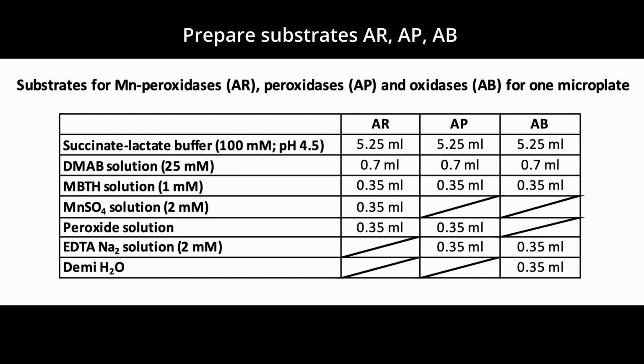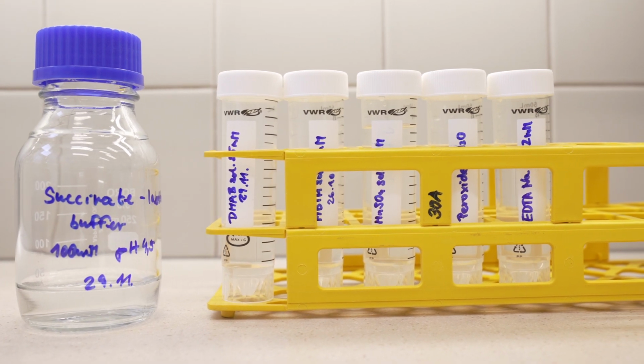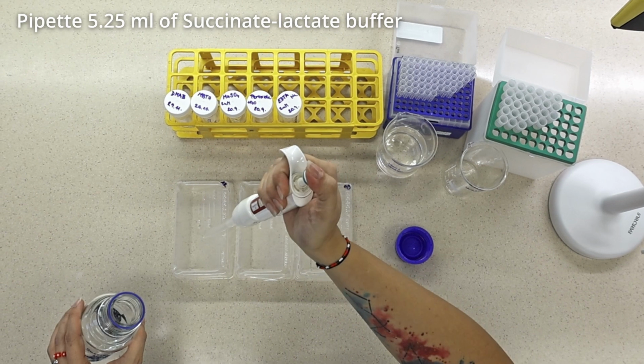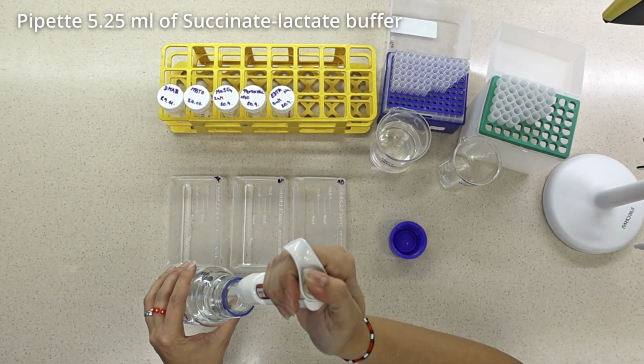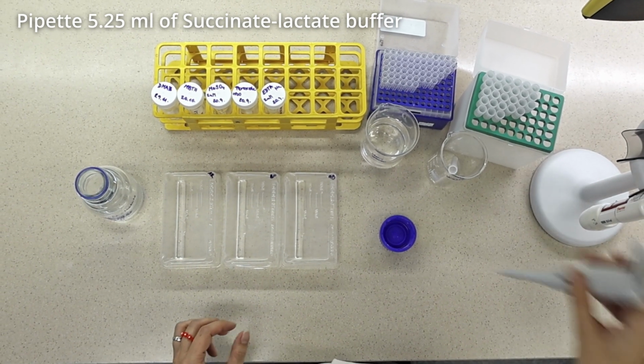The composition of each solution is shown on the screen. Volumes shown are calculated for 1 microplate, where 8 samples can be analyzed. The mixing of pre-prepared solutions is done in the labeled reagent reservoirs by pipetting the given volume of each solution.